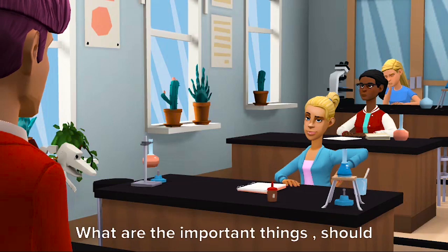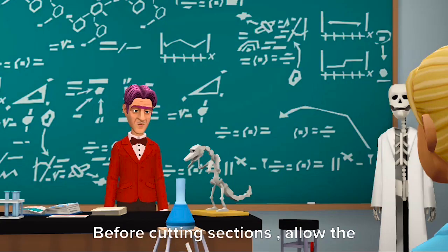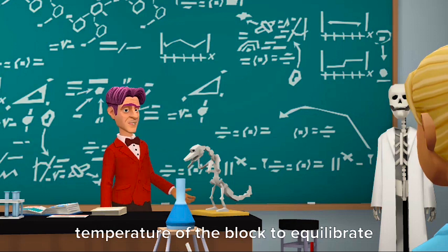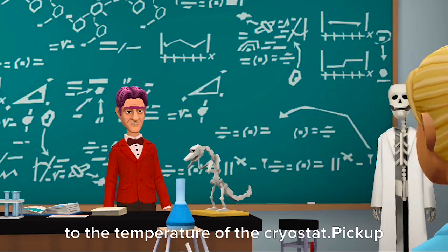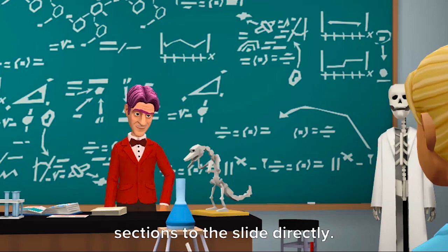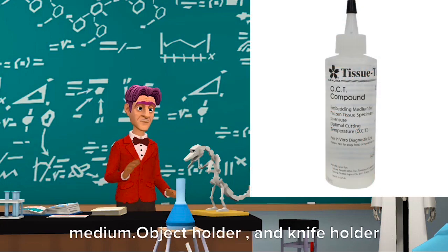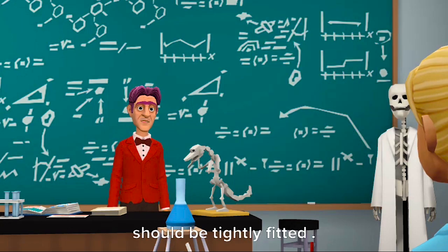What are the important things to know when doing this technique? Before cutting sections, allow the temperature of the block to equilibrate to the temperature of the cryostat. Pick up sections onto the slide directly. OCT medium has to be used as the embedding medium. The object holder and knife holder should be tightly fitted.